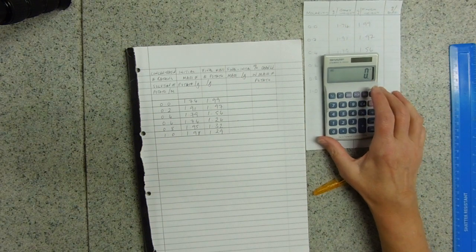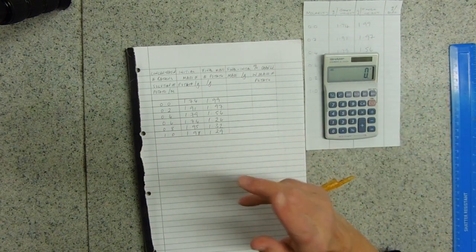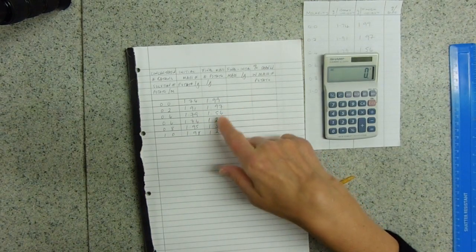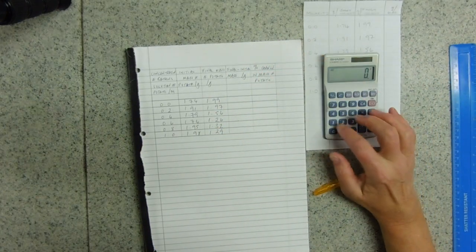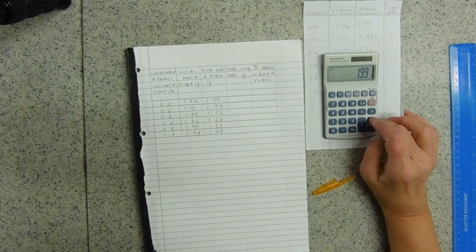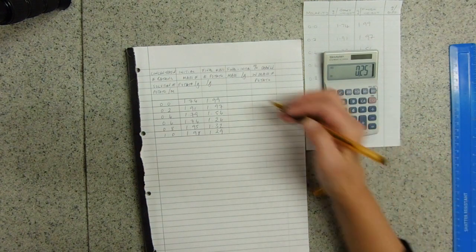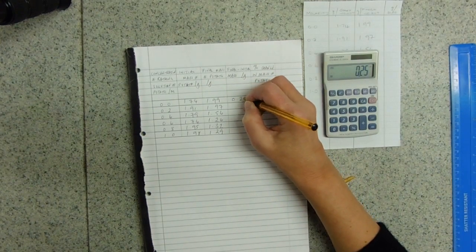Let's do the final minus the initial. Now the way I'm doing it this way: if my mass goes up I want a positive value, and if my mass goes down I want a negative value. So that's why I'm doing it that way round. 1.99 take away 1.74 equals 0.25. So that's my difference.